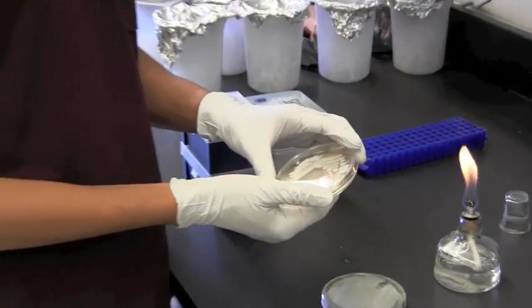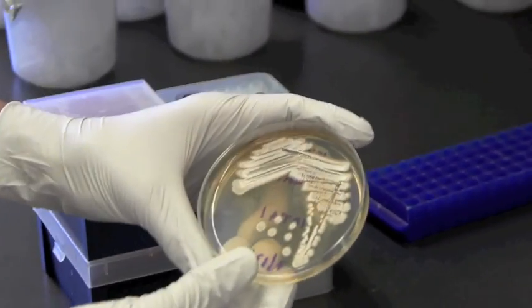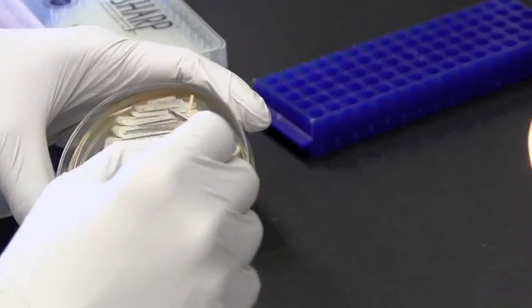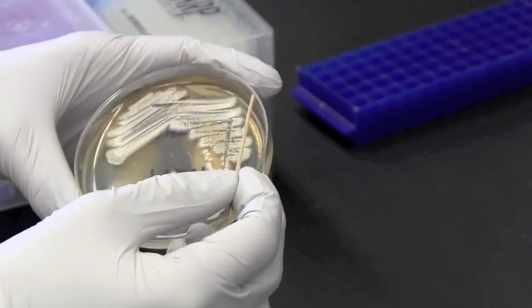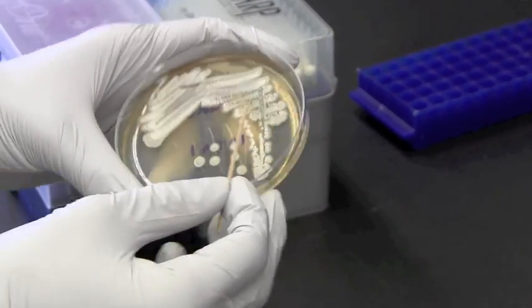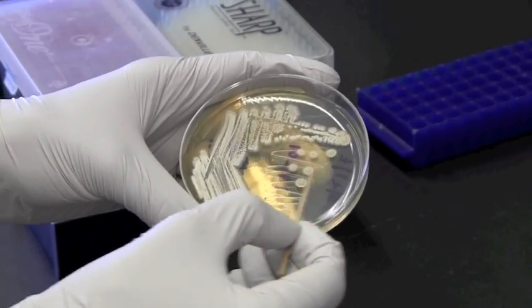So this is a soil bacterium, and as you can see there's my highly concentrated first streak in this corner, the slightly less concentrated second streak, and then the third one where we start seeing the single colonies that we can isolate.